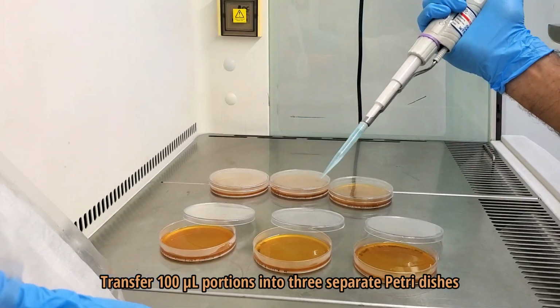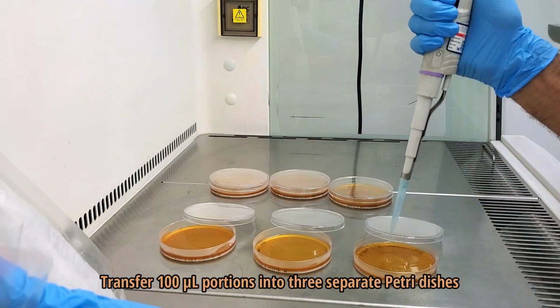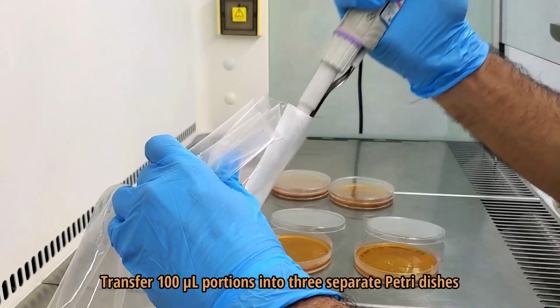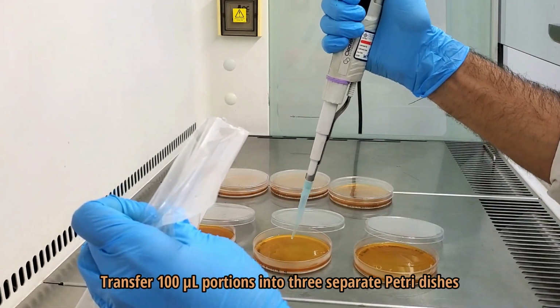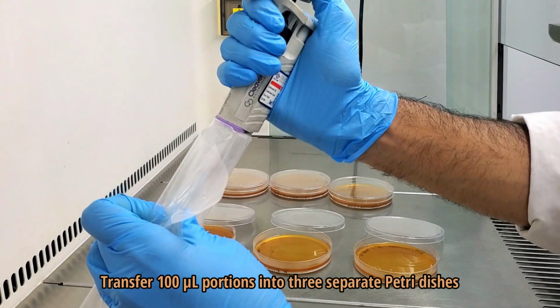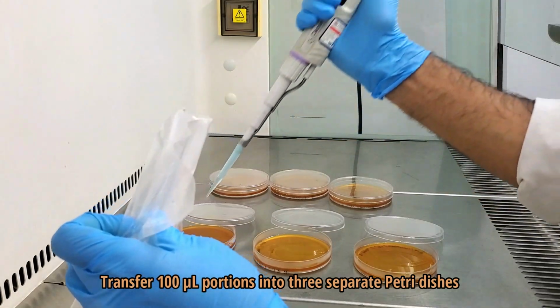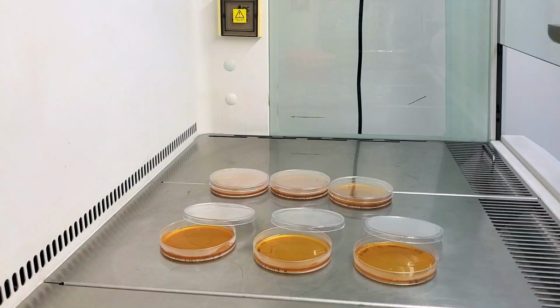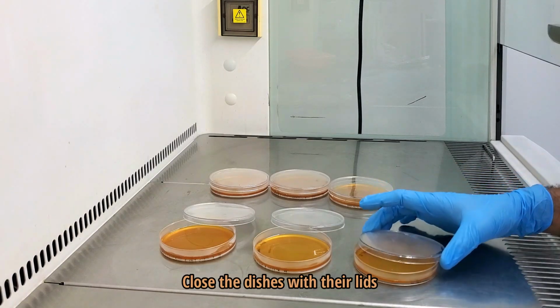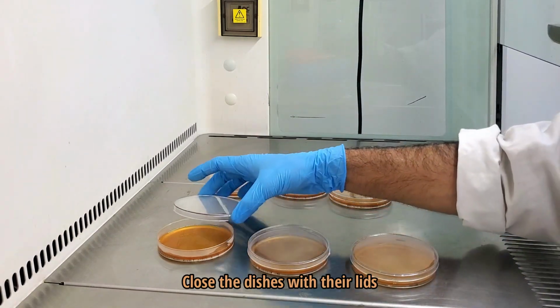Repeat the same process for the 10 times dilution sample, transferring 100 microliter portions into 3 separate Petri dishes. Close the dishes with their lids.